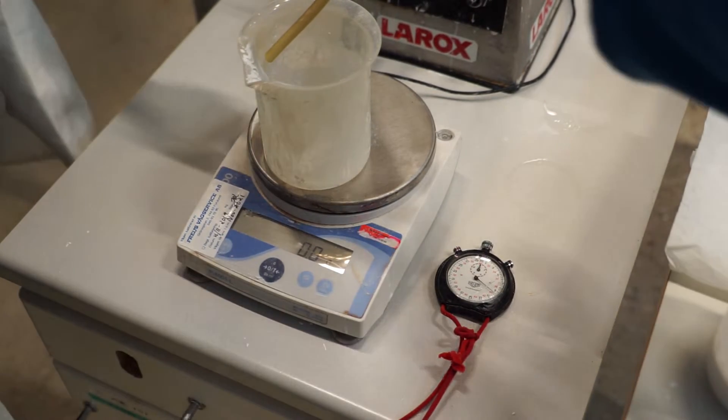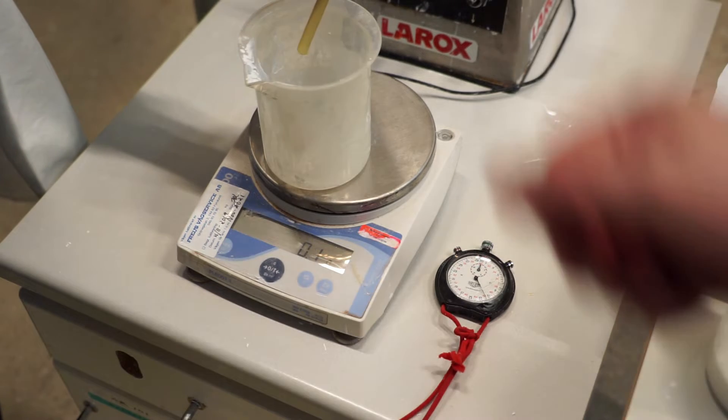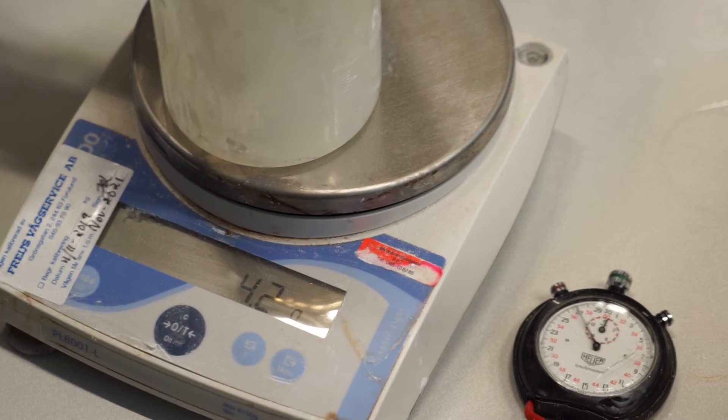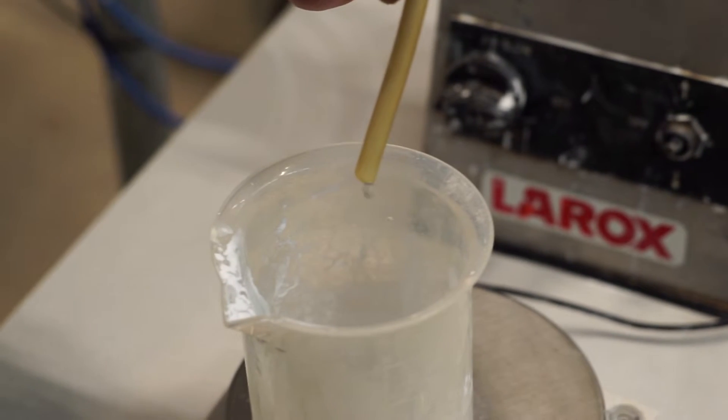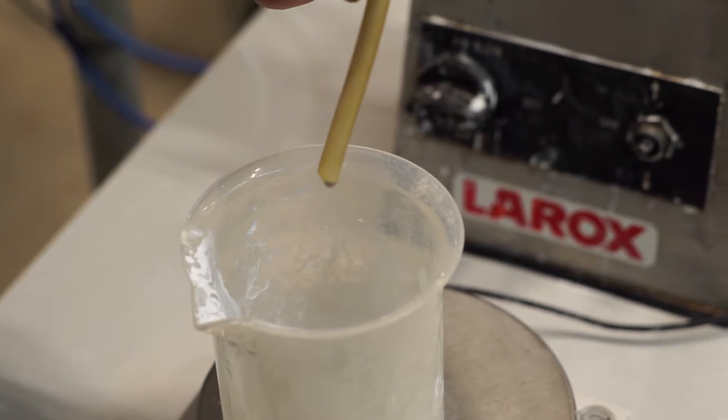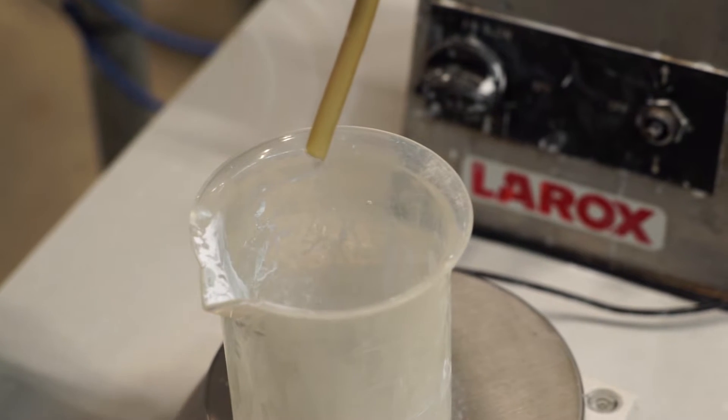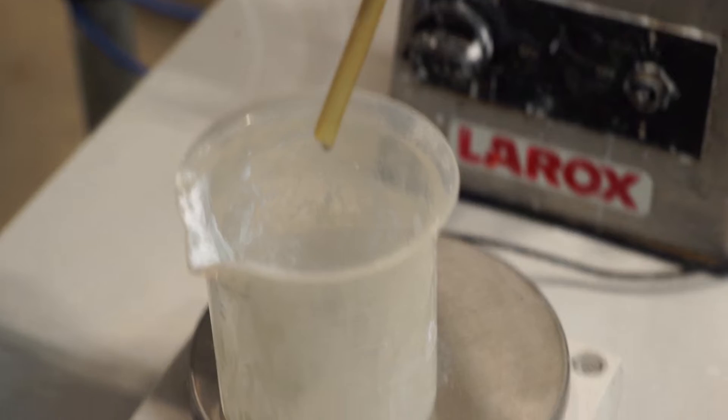Now it takes a couple of seconds to fill up the hose with liquid, but we will soon see liquid start flowing here. And a good thing is to actually note down when the first drop comes, at what time. But if you see the droplets, let's see. Yeah, there you have the droplets. And as you can see, these are not creamy white anymore. It's a clear liquid.